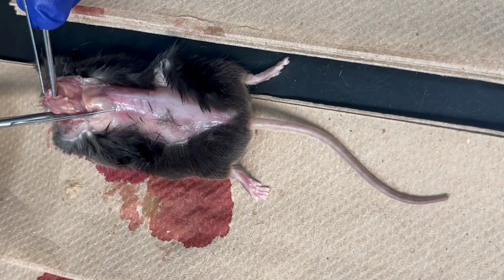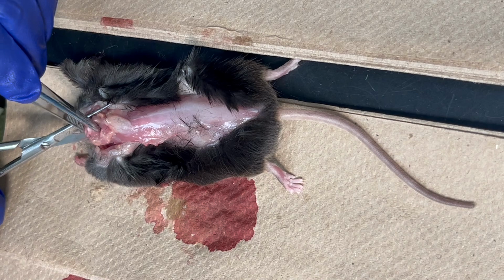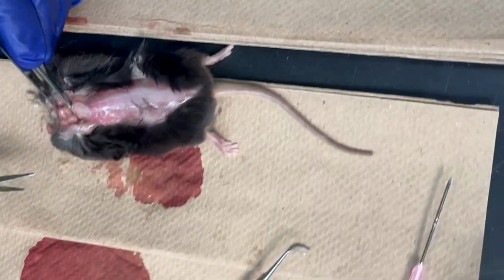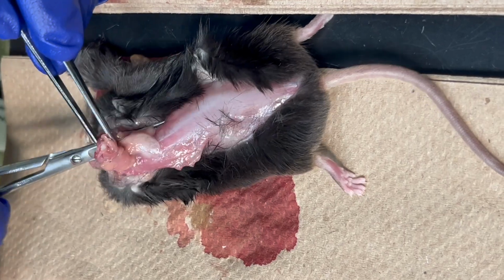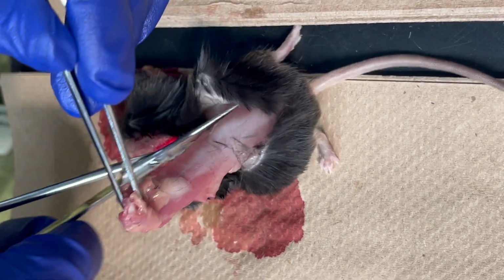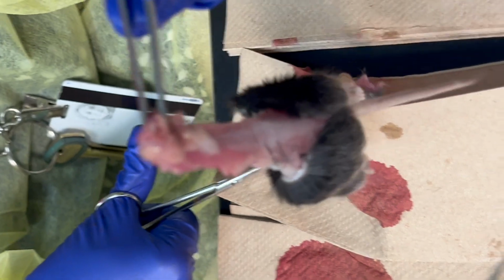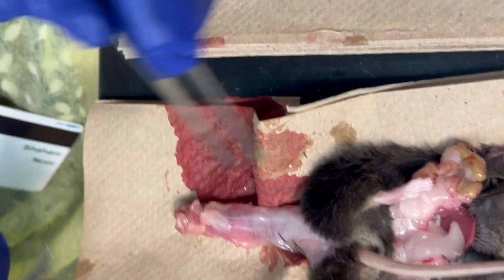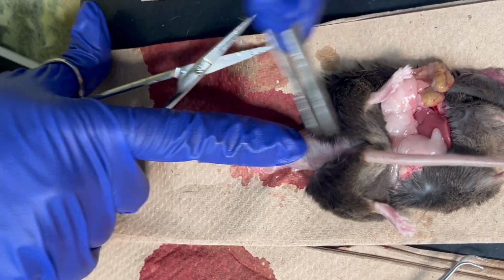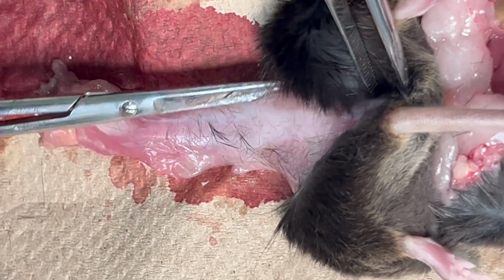So all I'm doing here is isolating the column itself, right? That's the trick here. The hole is here, where the spinal cord is. You want to simply try cutting as far as you can go. And you'll see, if you simply flip it like this, so this is where I'm going to cut, here. It's kind of got narrower over time. If this is too far, this is probably the best place to cut, right here.